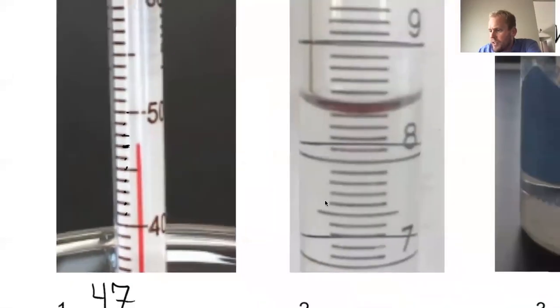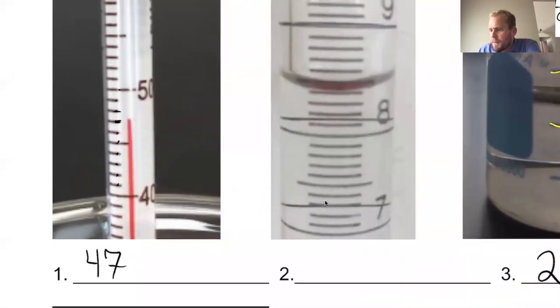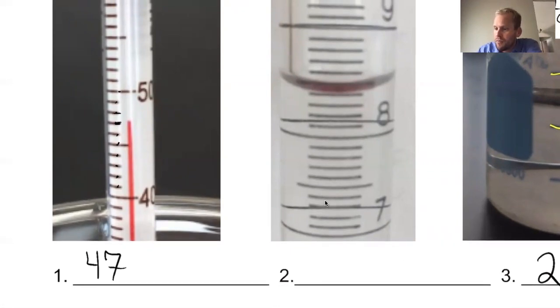And by the way, what's going to be the increment of the estimates? If we were going by ones here, okay, 40, 41, 42, 43, 44, 45, 46, 47. If we were going by ones, that means the graduate's going by ones, so our estimate has to be an increment of 1/10 of 1. In other words, 0.1. So you need to make an estimate in an increment of 0.1.